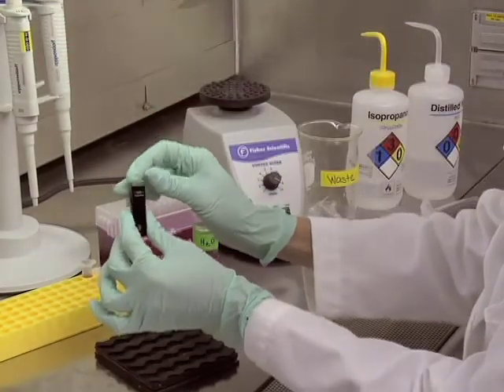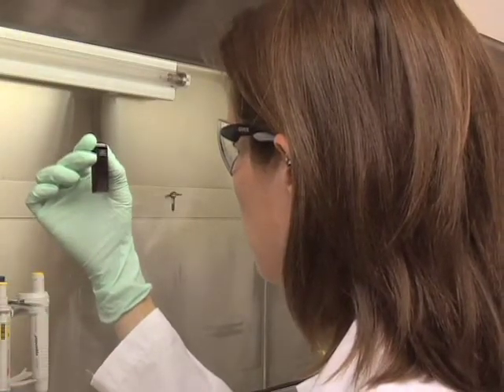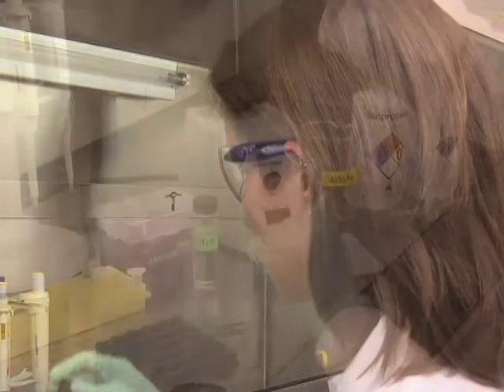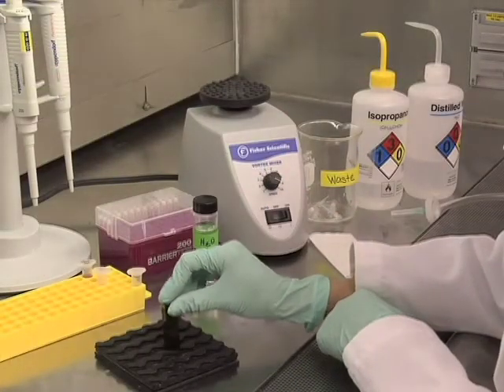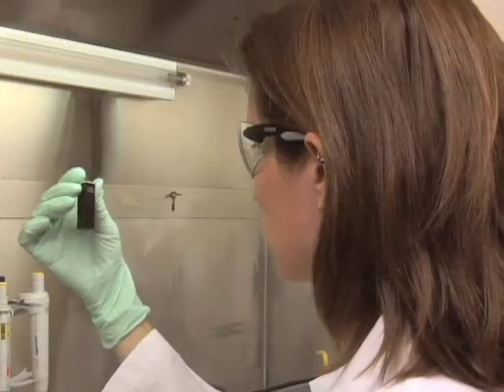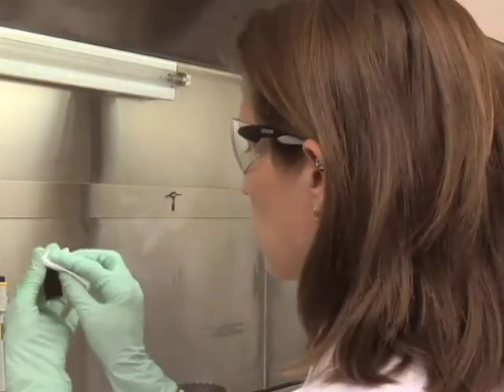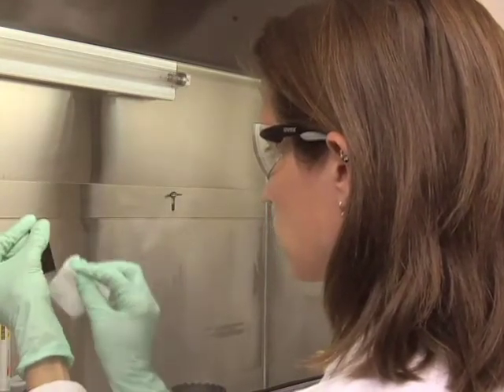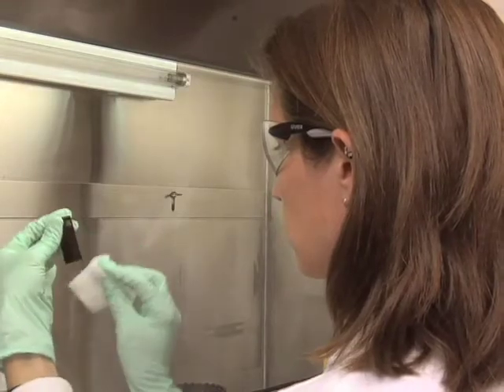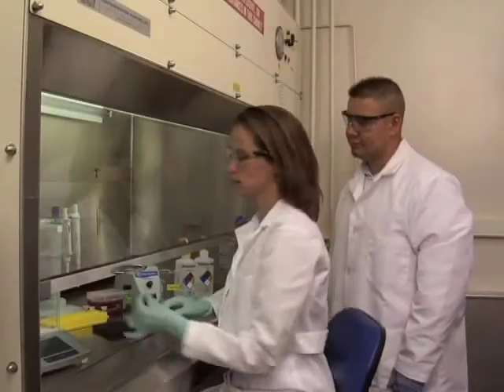After placing the cap on the cuvette, you will want to inspect to see if there are any air bubbles. If you have air bubbles, they can be dislodged by tapping gently on a soft surface, checking again to make sure they are gone. Lastly, you will want to wipe the outside of the cuvette with lens paper to remove all dust, checking to make sure it is clean. You are then ready to make your measurements.